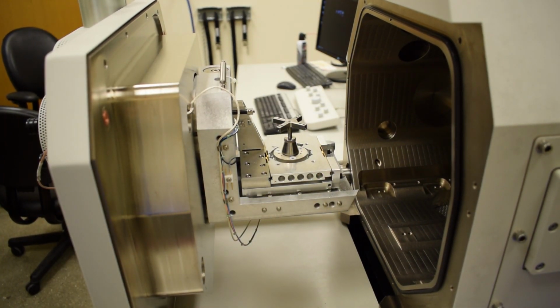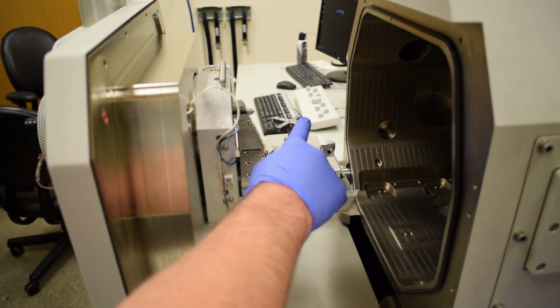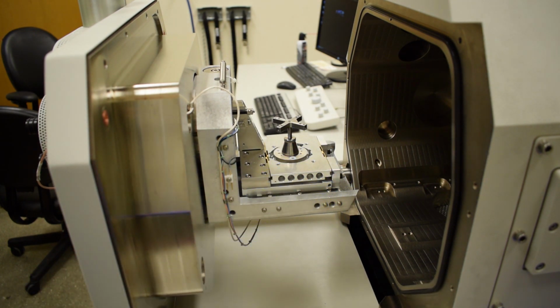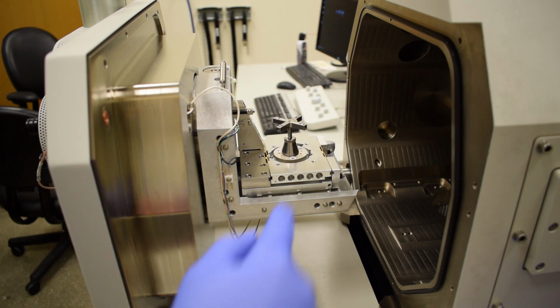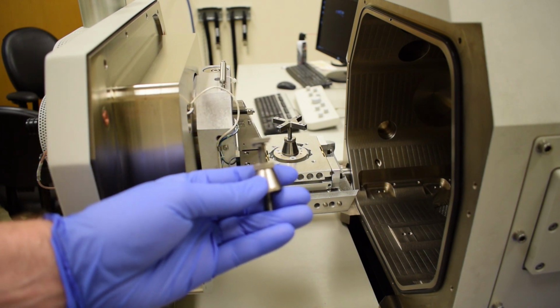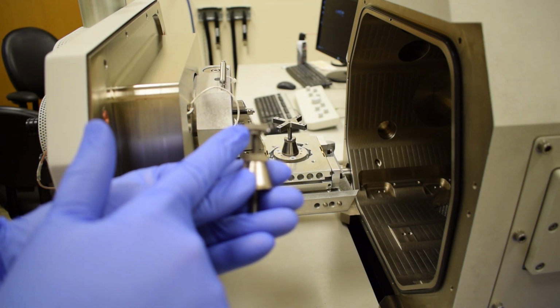In order to hold on to our samples, we need to use a stage adapter, which is screwed into the rotation plate of the stage. Now the stage adapters are removable and they are height adjustable. We have two different adapters that are commonly used in our facility for this microscope. The adapter that is on the stage right now can hold up to 5 small SEM stubs at a single time. The other adapter can hold a single SEM stub.